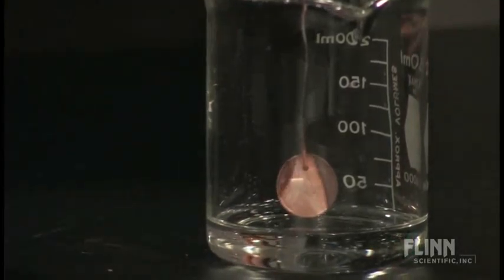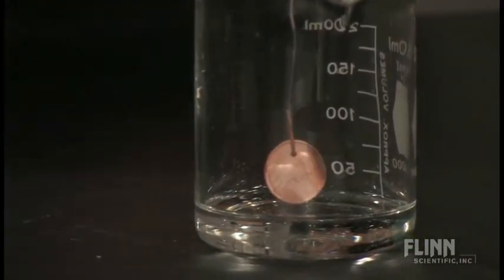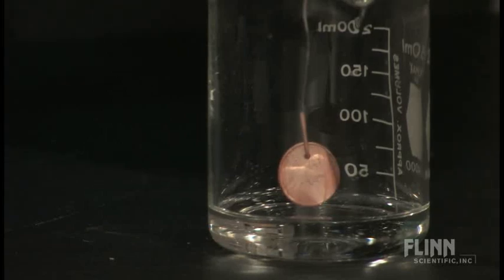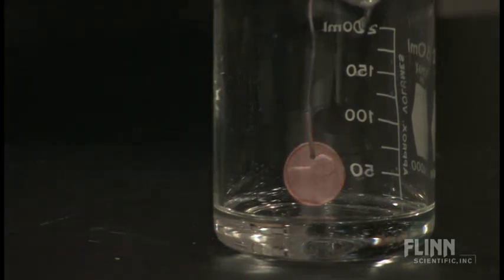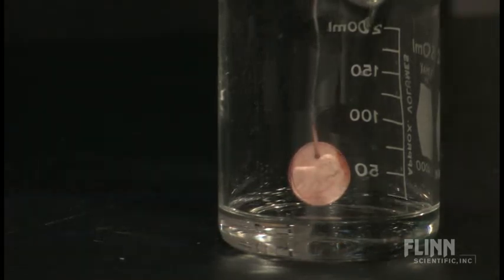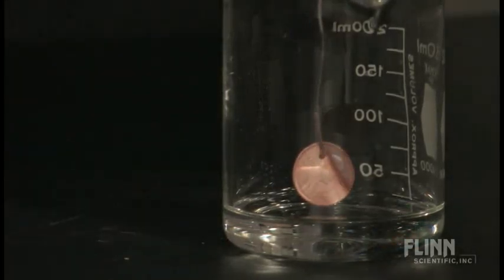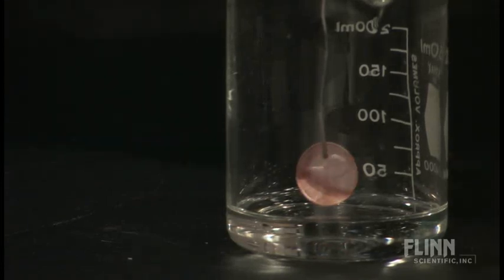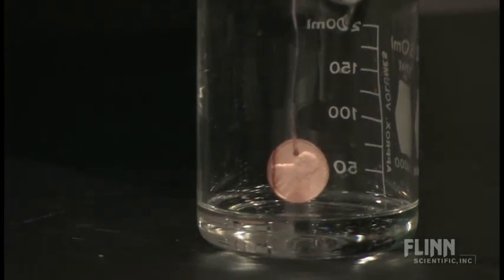You can see it gets darker and then red again — light and dark and red, back and forth. As the acetone vapors waft across the surface, they cool it, but then they react. The acetone reacts, forming some ketenes, some methane perhaps, and other oxidation products — it's a somewhat complicated reaction. The key point is that this is a highly exothermic reaction; otherwise the catalyst wouldn't stay hot. It stays hot because the reaction itself is giving off heat to keep the reaction going.